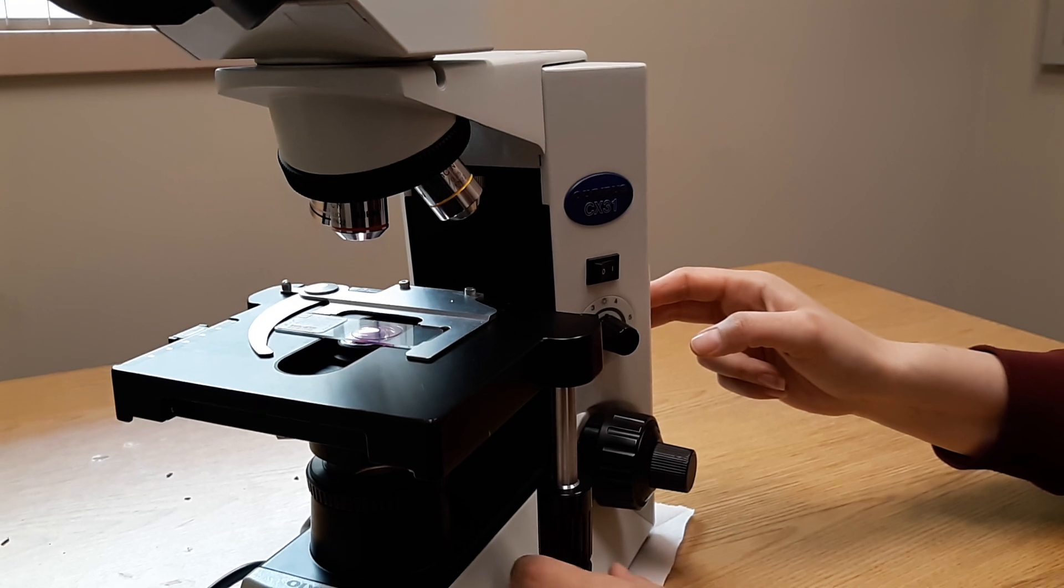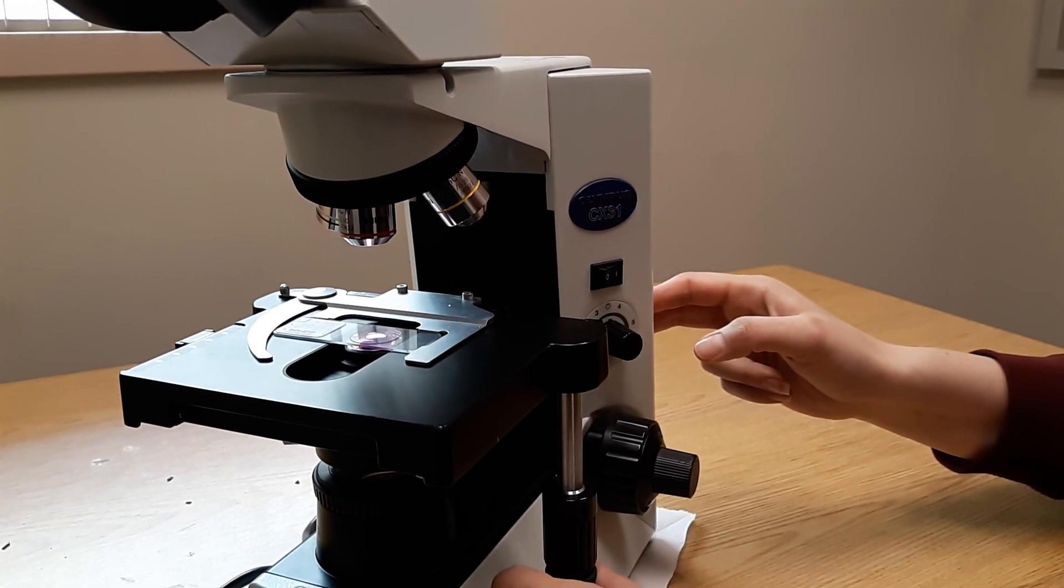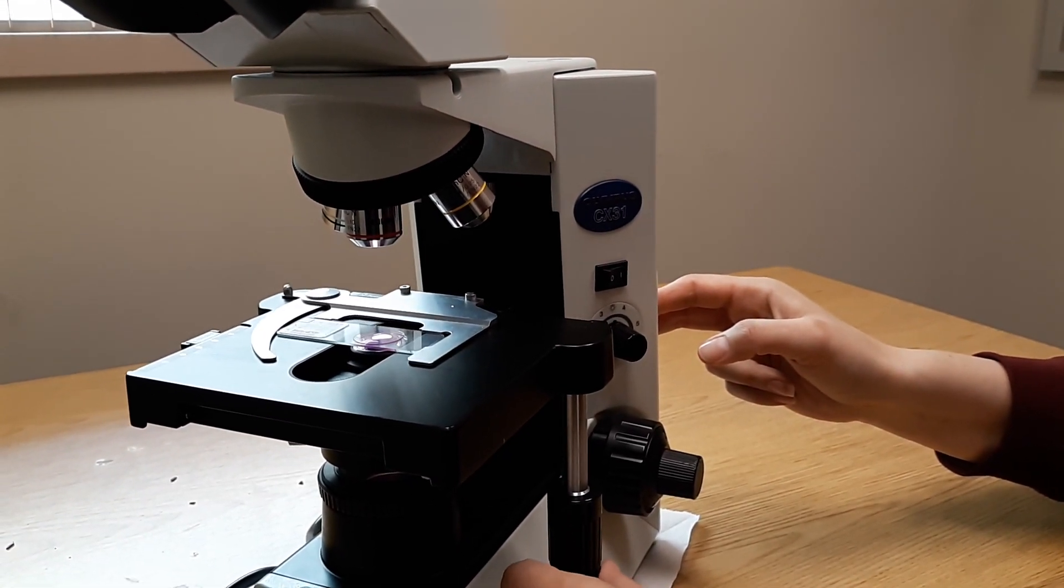Right now I'm using the top knob to move it forward, and then the bottom knob to move it left so that it's perfectly illuminated.